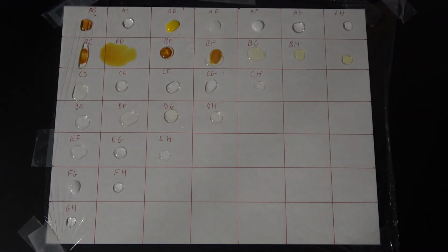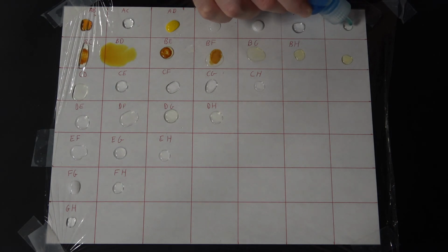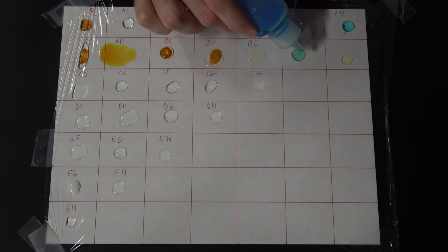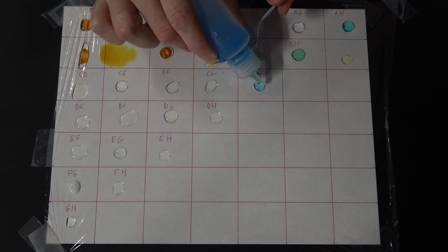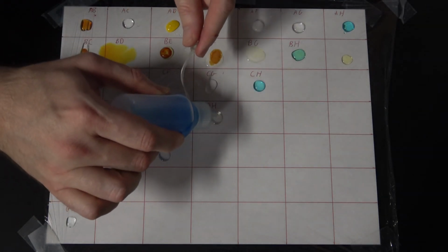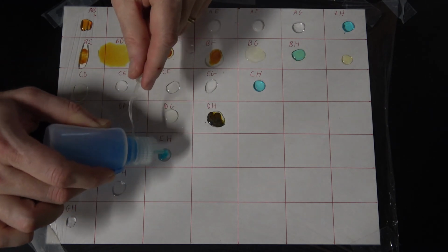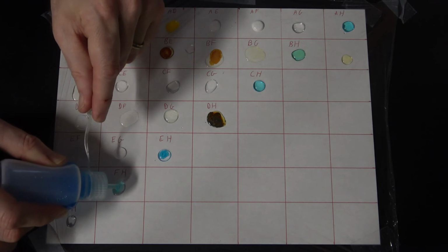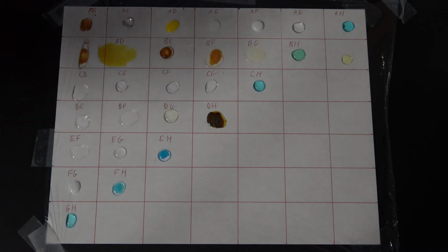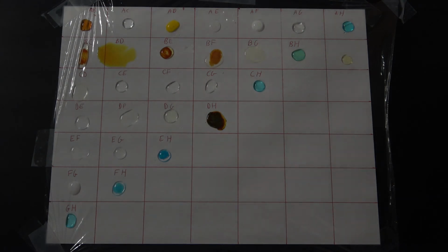And finally H. Now, as you've probably already figured out, 4 of these chemicals should be pretty easy for you to determine, simply because they are already colored when we start out. The rest of them you need to puzzle out. Of course, the ones that are problematic are the clear colorless solutions. So you need to figure those out. And I will tell you that there are two of them that are hard to tell apart. So just do the best that you can.